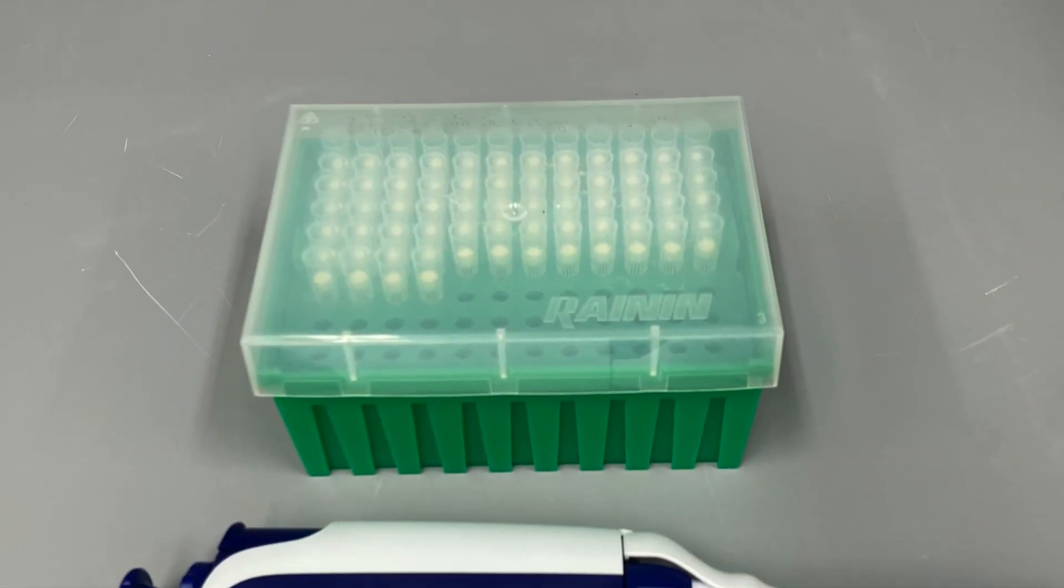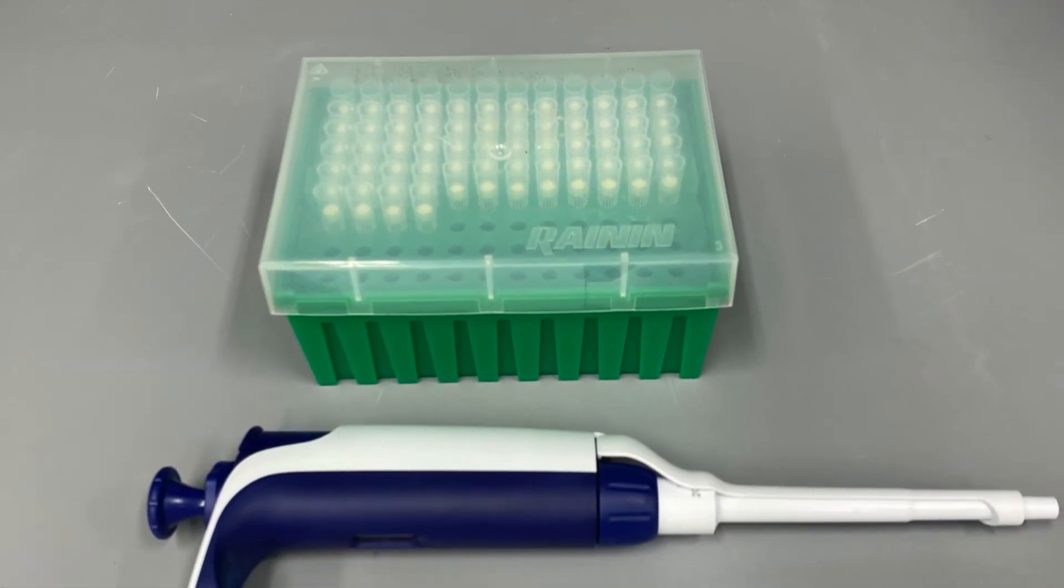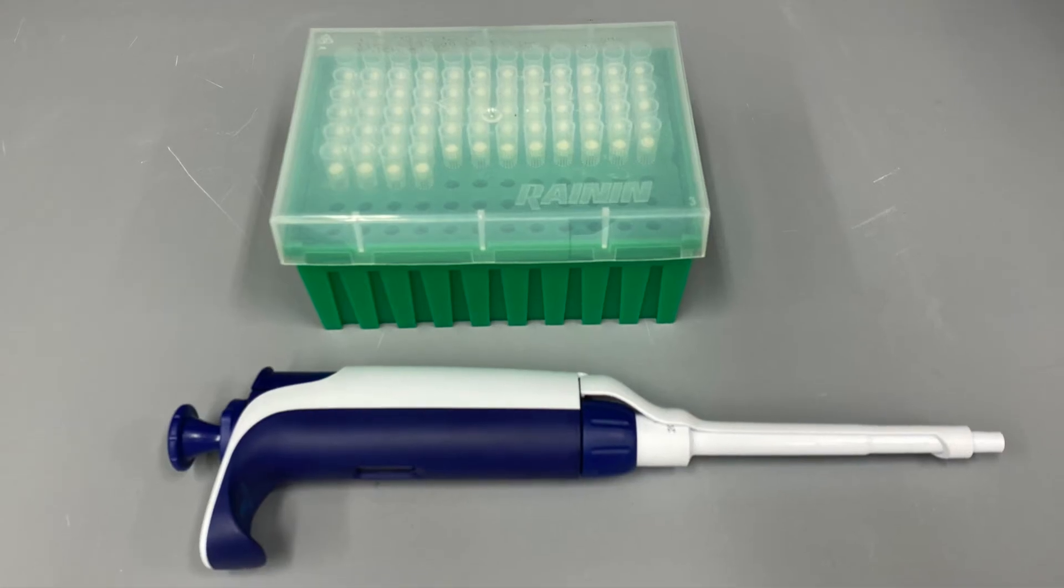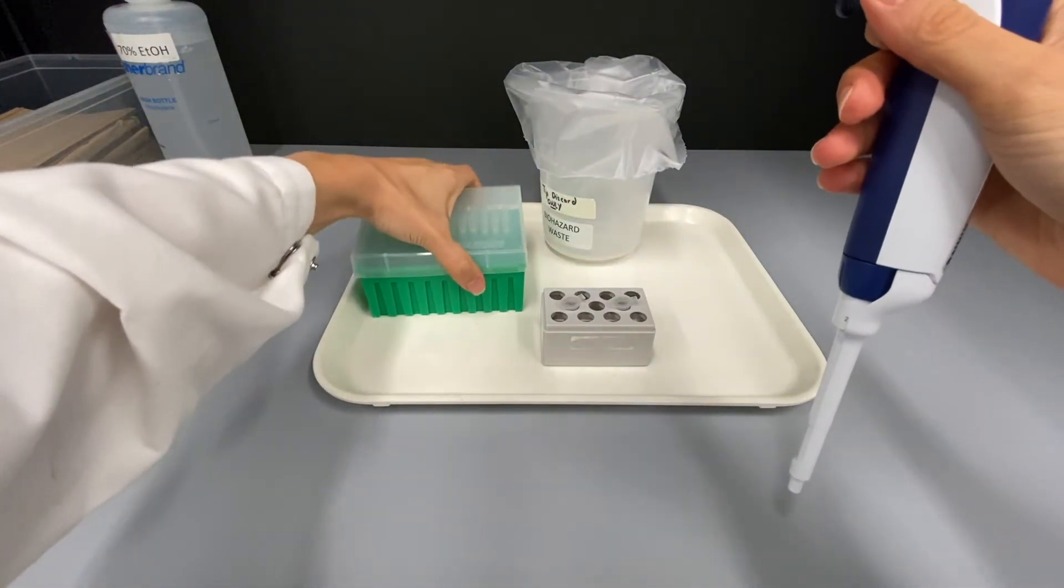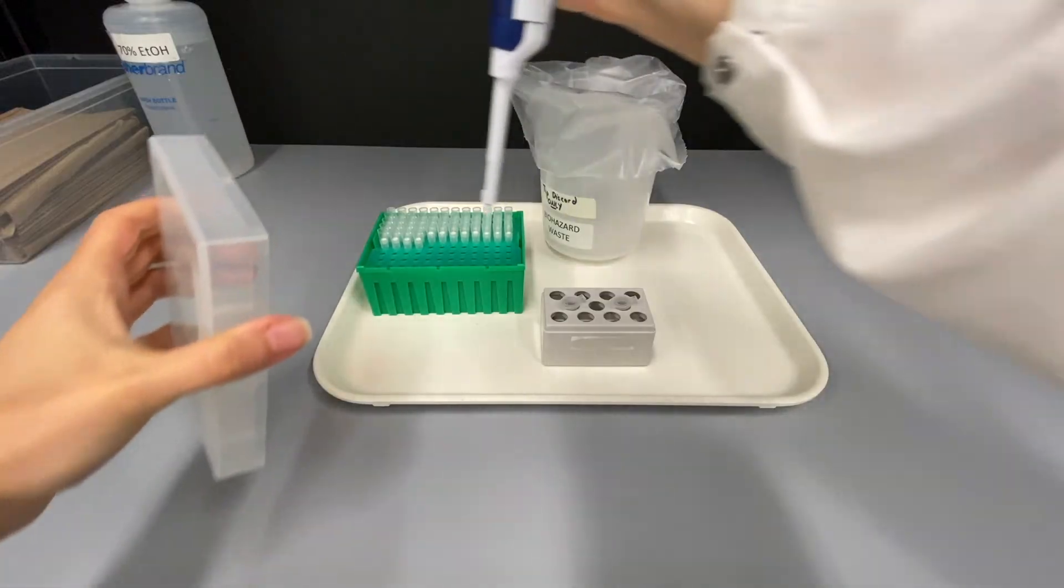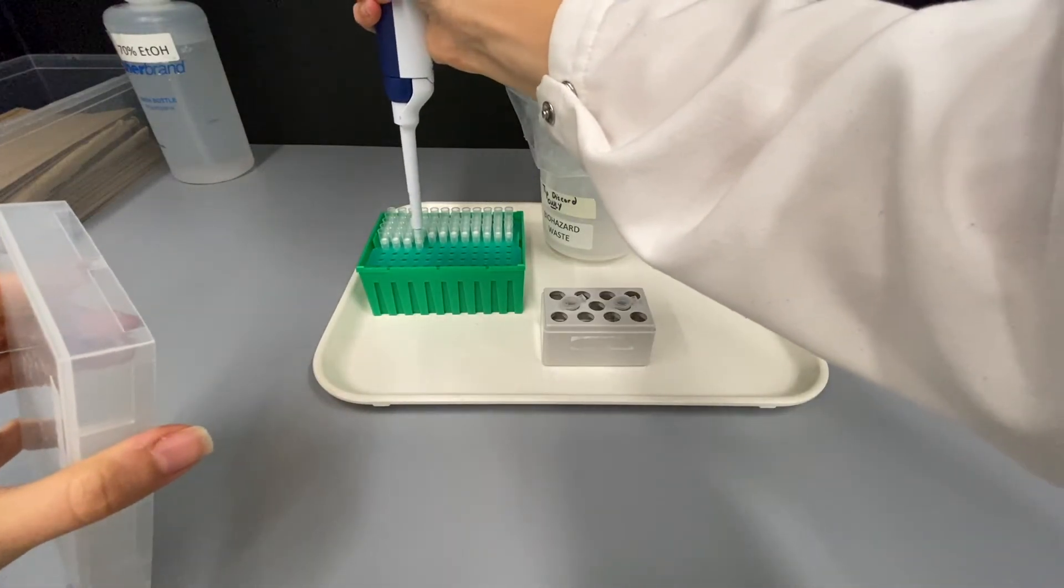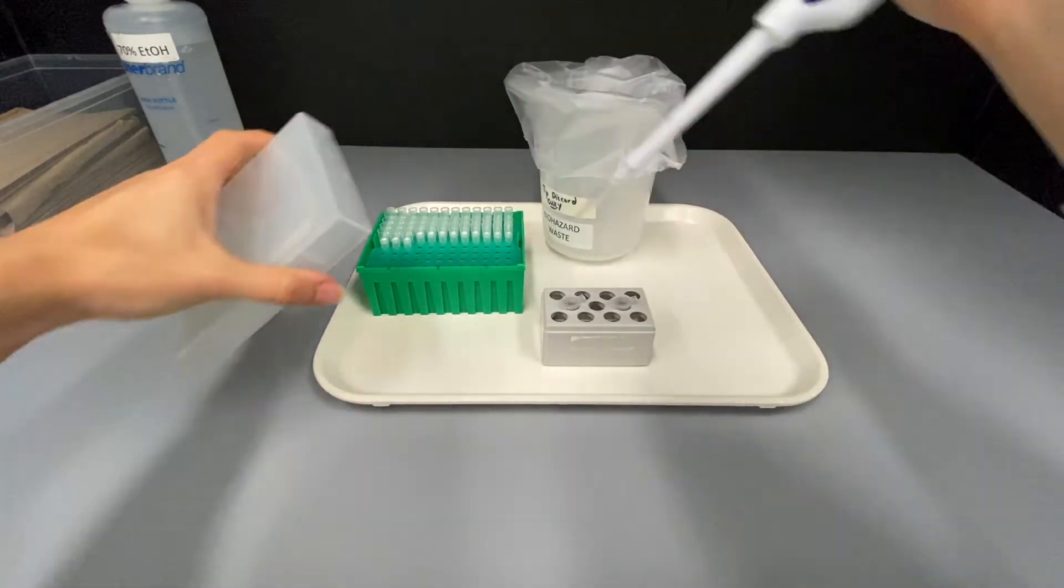Here is a box containing tips. These tips are specific to the micropipette size that you are using. Lift the lid of the tip box, put the pipette in a tip and push firmly to ensure a proper seal, but not so hard as to damage the pipette.